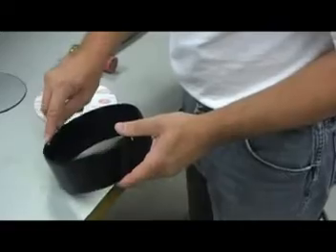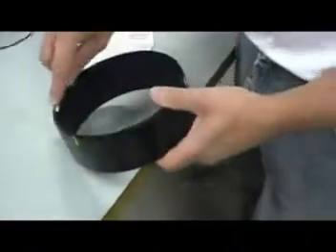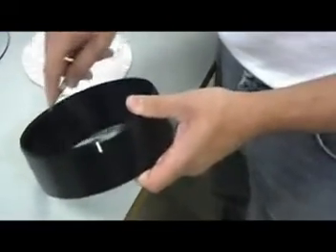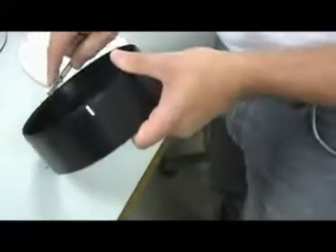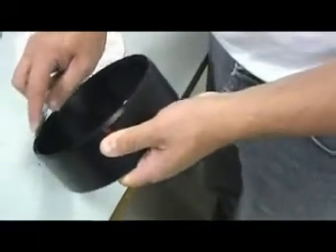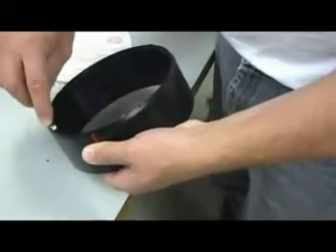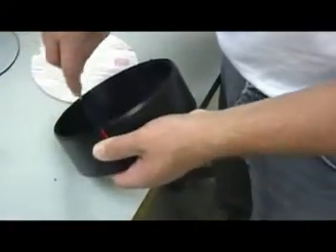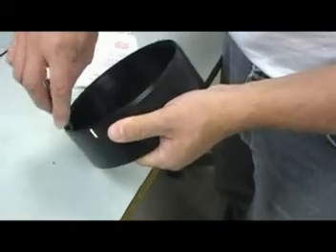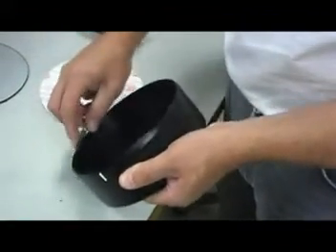Now what we're going to want to do is remove all the old RTV from the sample ring. A razor blade, a small flathead screwdriver, or a small scraper can be used, but all the old RTV must be completely removed. You need to take your time doing this. The new RTV won't adhere where the old RTV is, so we do have to be careful to make sure we have that groove as clean as possible.